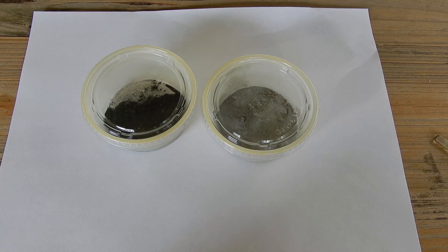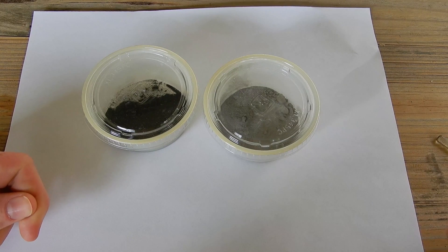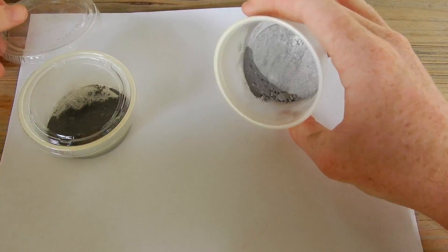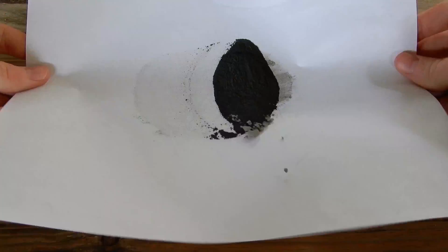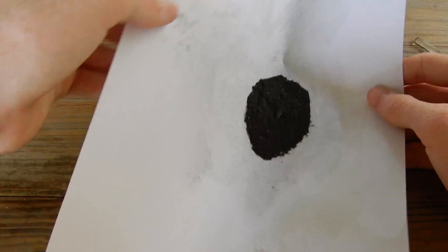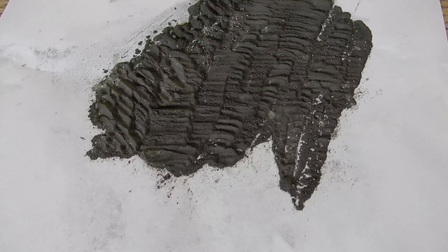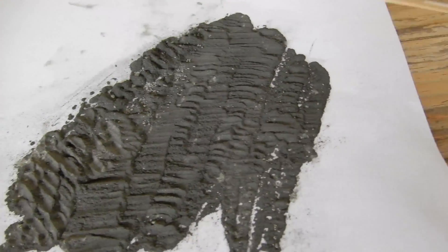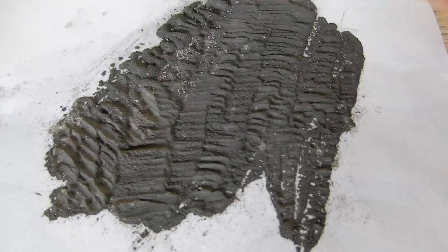After deep consideration and getting loads of criticism over the years, I've decided to mix my thermite today with the paper folding method. I'm not going to grind it in a mortar and pestle, I'm not going to mix it by smashing a hammer into the mixture, I'm not going to mix it by using a lit wooden splint. I'm going to be safe today. What just happened was I spent five minutes doing this because I didn't grind up the aluminum powder before I combined it with the nickel oxide — I had to crush all these little lumps.